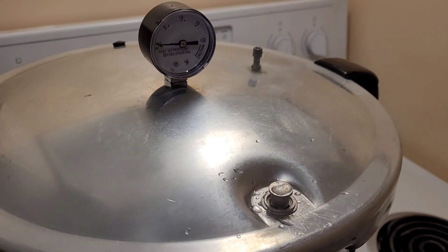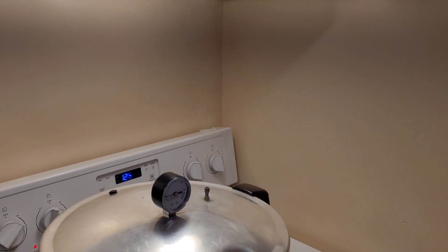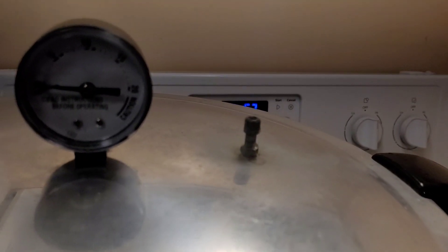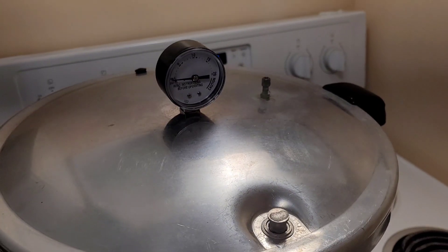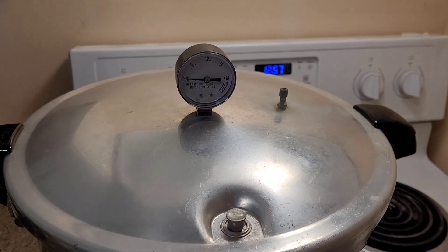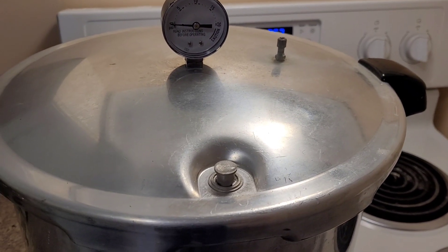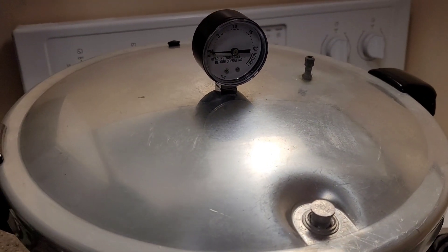The lid lock has just popped — the steam is now freely flowing out of the vent tube. You can hear sputtering and burping coming from there — that's all of the trapped dry gas encapsulated within the jars and the vessel itself. This is the time to start your 10 to 15 minute timer. Ten minutes is the minimum; I prefer 15. The more time you allow for trapped gases to be expelled, purged, or replaced by steam, the more likely you'll have an appropriate internal temperature and sufficient steam penetration into the load.